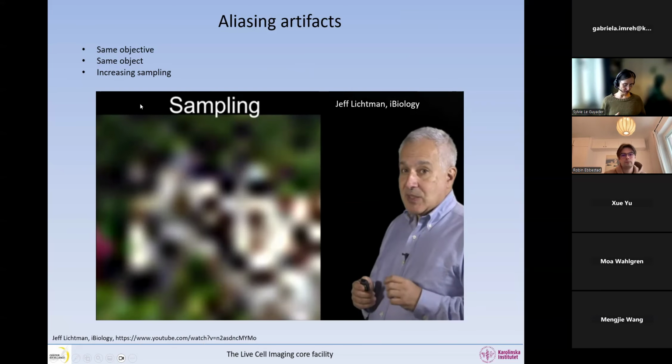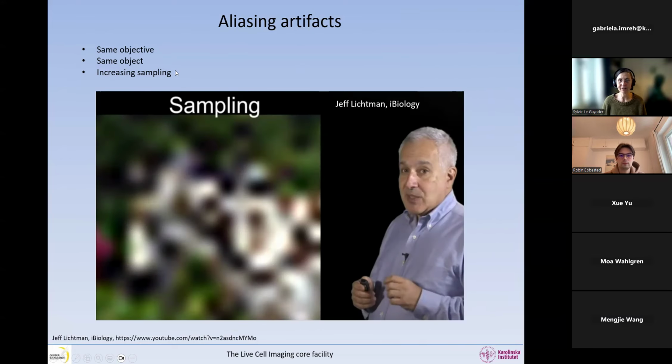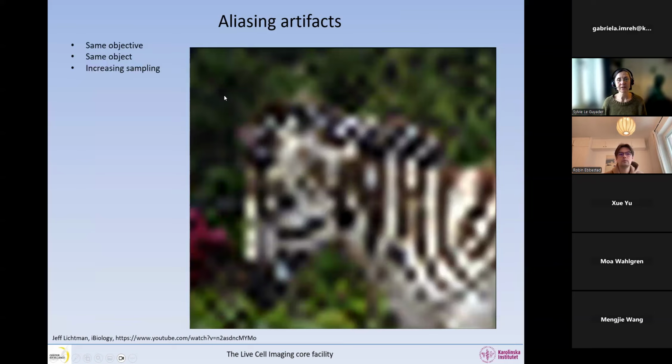So in these images, I took some screenshots, and in these images, you will see we are always using the same objective and the same object. And I guess quite quickly you will recognize what this object is, but we're increasing the sampling. So you can see this poor zebra. I'm sure you have guessed it is a zebra. And we are now imaging the zebra with a very low sampling, so very big pixels. And what we can see is we see things that actually do not exist. It's not possible. Zebras do not have bridges like this. So some things are created in the image because of undersampling.